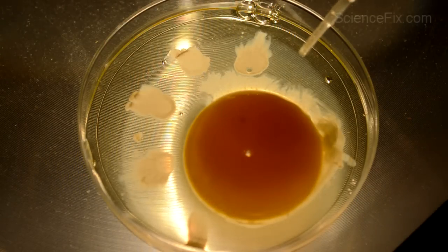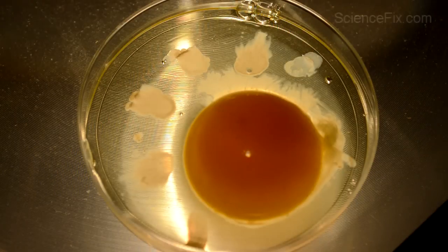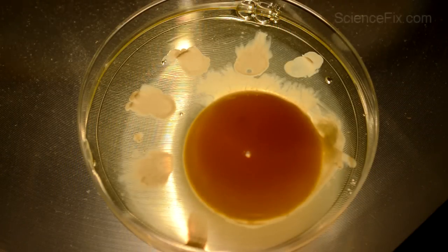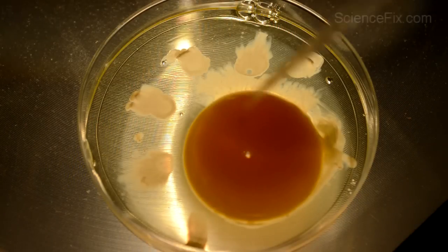The egg white, that damage to the egg white or the change to the egg white cannot be reversed. Once it's done, it's done, and it's permanent. So hopefully that gets across to students.